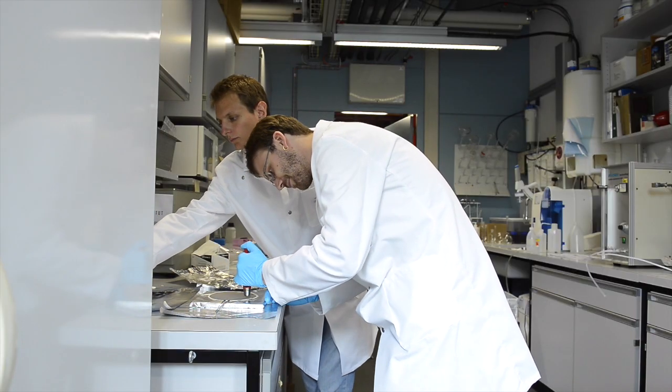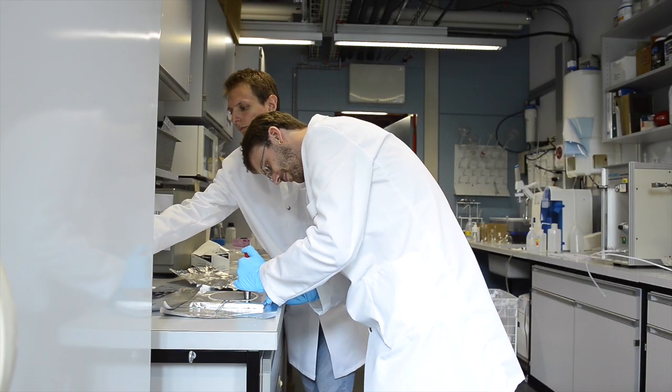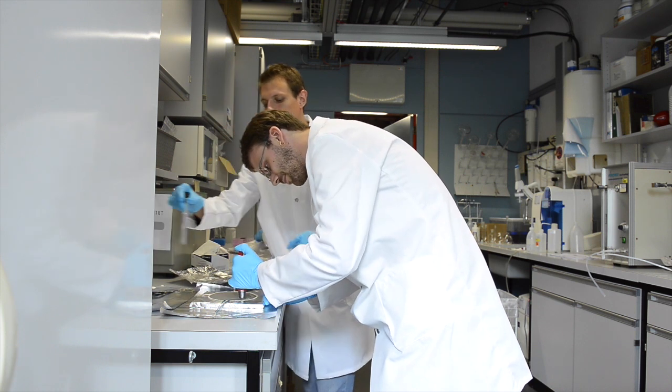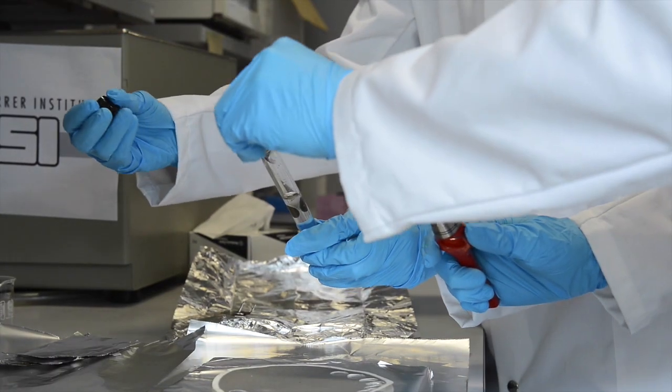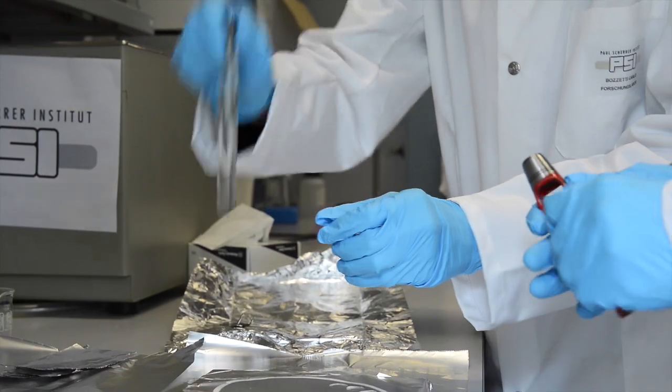After the filters come to PSI, they're stored in a cool environment. We punch some small pieces, put them in water, and extract the particulate matter into this water phase.